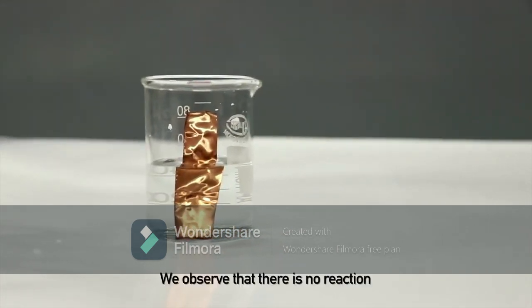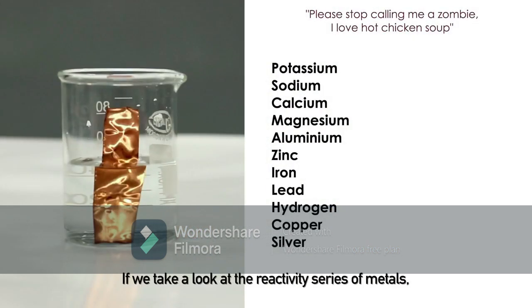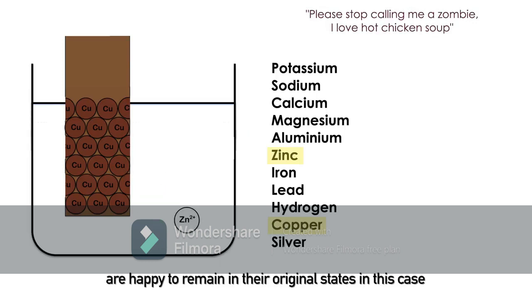We observe that there is no reaction between copper and zinc sulfate. Why is this so? If we take a look at the reactivity series of metals, we know that copper is less reactive than zinc. Thus, both the copper atoms and zinc ions are happy to remain in their original states in this case, and no redox reaction occurs.